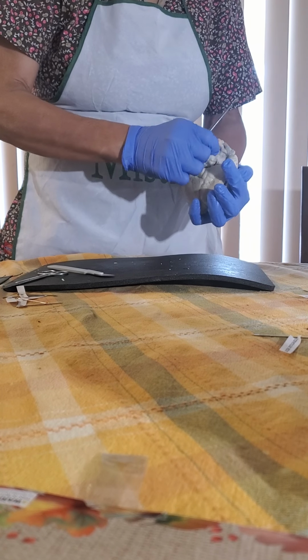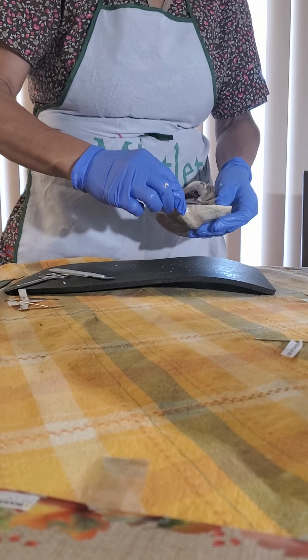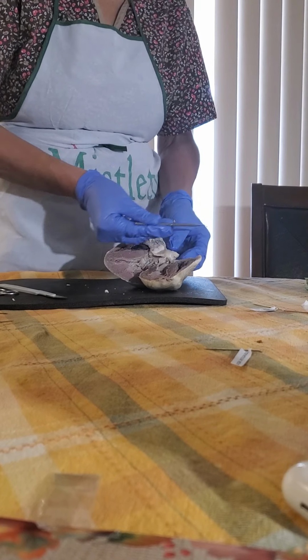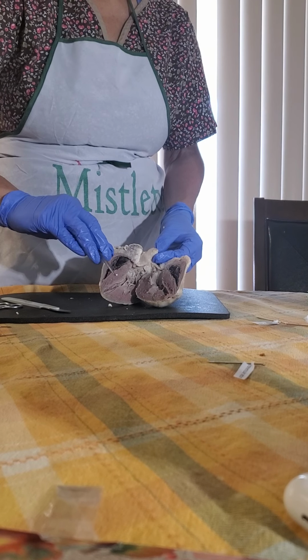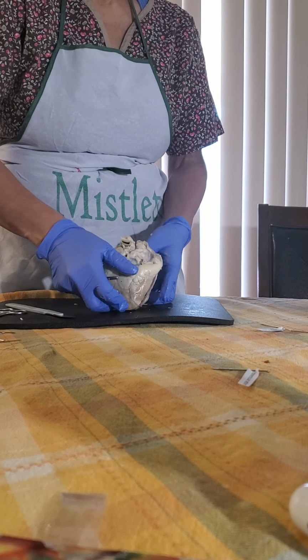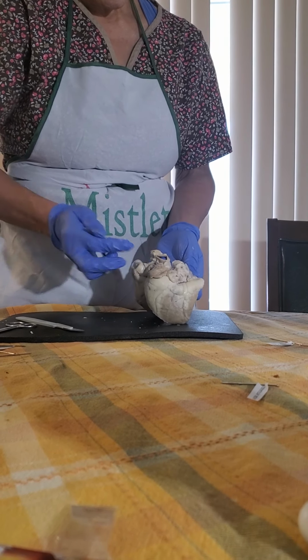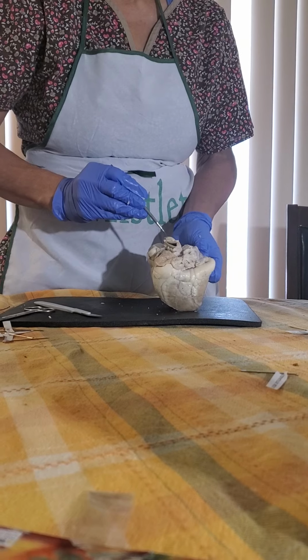And it's going to pump out, moving past the semilunar valve. It looks like a thin half moon, with thick valves that allow blood to move up and out. The blood goes back to the ventricle again, passes the semilunar valve, and the valve shuts to put the blood out. Now you can see the aorta. The aorta is the big and thick one. And then you see the brachiocephalic artery, which is going to carry the blood to the head and the rest of the body.